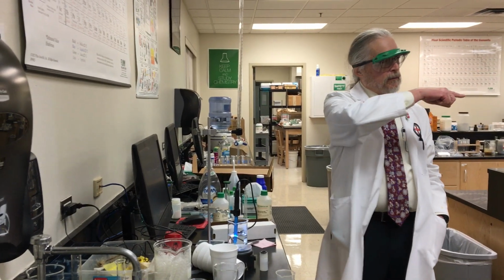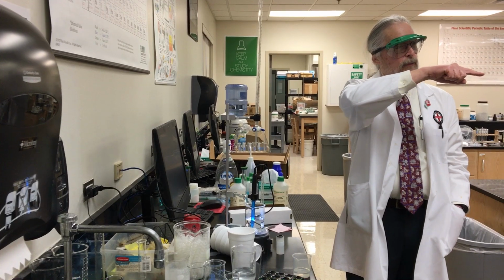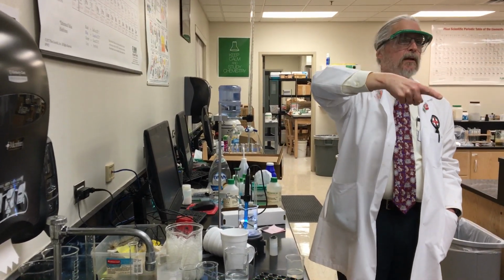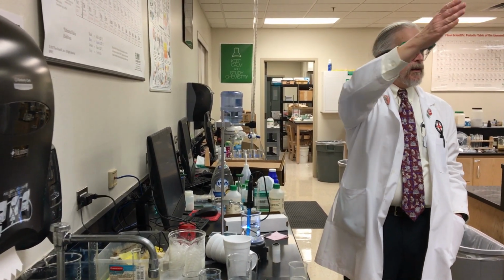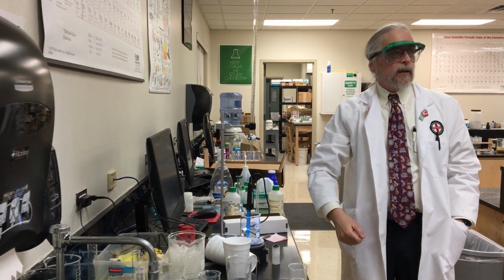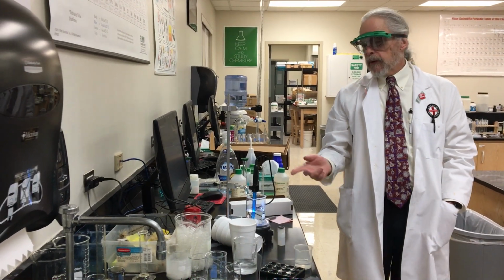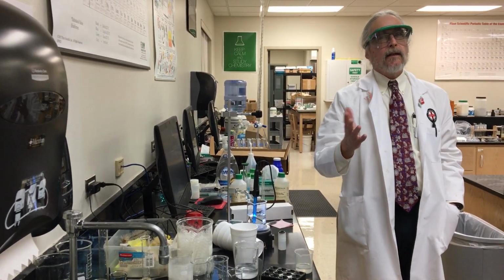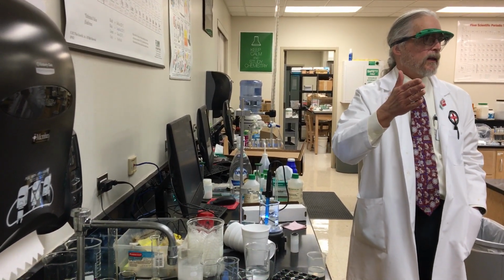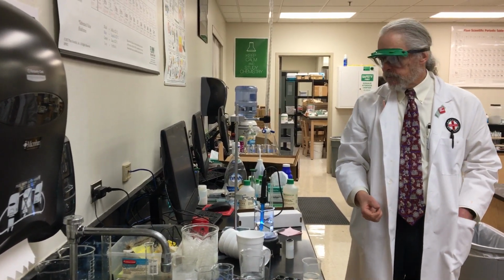But think about how your little graph goes. It's going to be hanging about 1, 1.5, 1.5, 1.5, 1.5. Boom! Right. When it goes boom, it's going to go right past 6, 7, 8 altogether. That part of your graph is basically vertical. So that's what we call in chemistry close enough. I want something that is going to change color within a point or two pH-wise of what the equivalence point should be. And it is so vertical at that point, it's not going to make any difference.